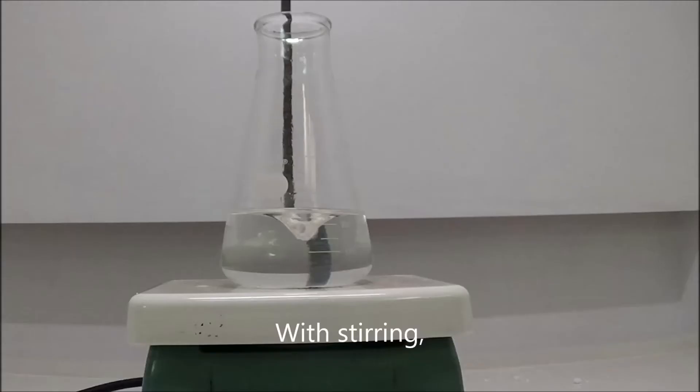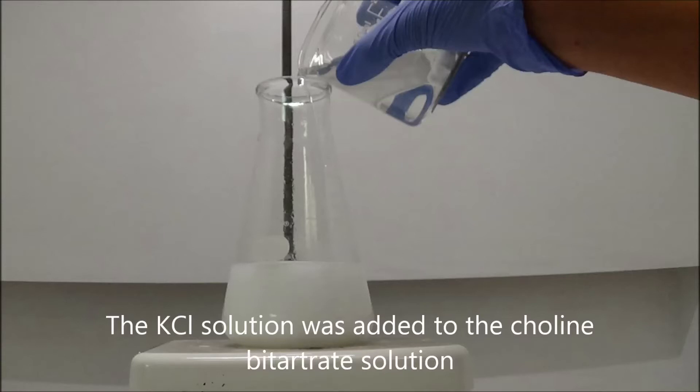The two solutions were combined, immediately precipitating a white solid.